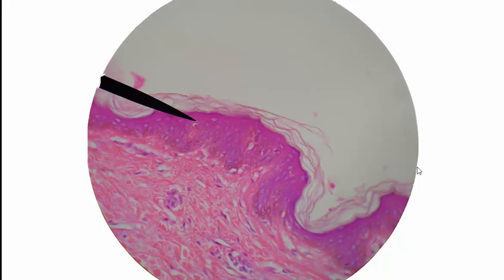Moving on to the next image, this is actually higher magnification. That last image must have been 100 times magnification. This is 450 times magnification. It's an even better picture for looking at those five layers of the epidermis. Here's stratum corneum again, and remember, of those layers, there's one missing for thin skin, and that is the stratum lucidum. There's no stratum lucidum here. Stratum granulosum, stratum spinosum, and then stratum basale. And those are the layers of the epidermis. And then down here we see the dermis. And that's about all I wanted to show you from this picture.